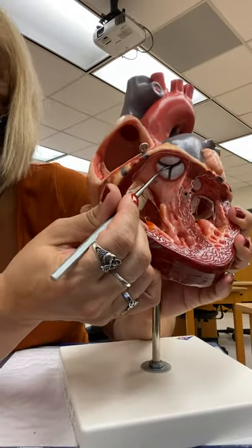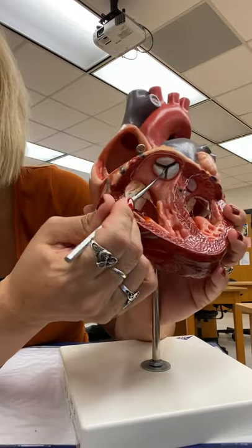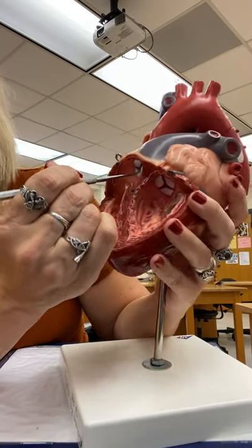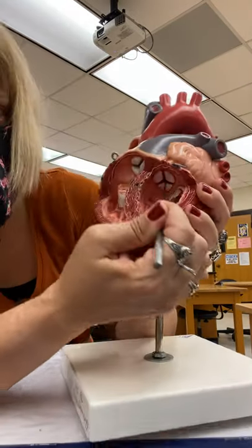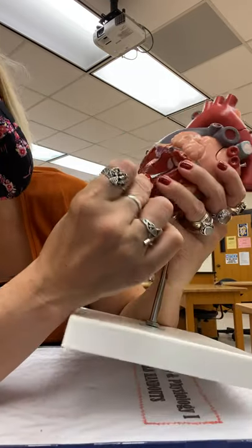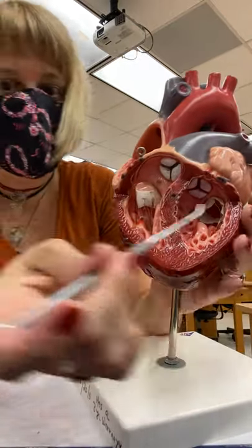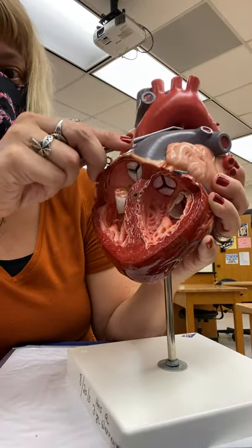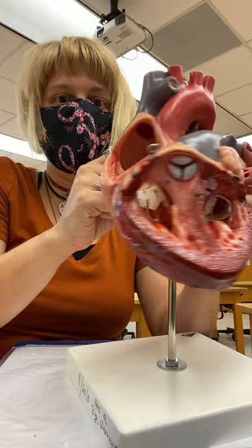The papillary muscle is going to activate and close down those valves and pull on the chordae tendineae. Right here — that's the pulmonary trunk. There's the pulmonary valve with the peace sign. These are all semilunar valves. And right here is the aortic valve. So you've got the pulmonary valve going out this way to the pulmonary trunk.